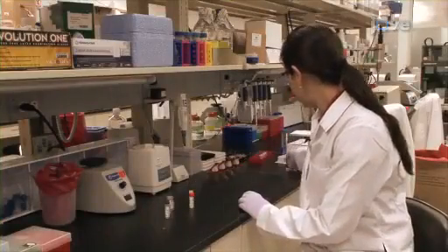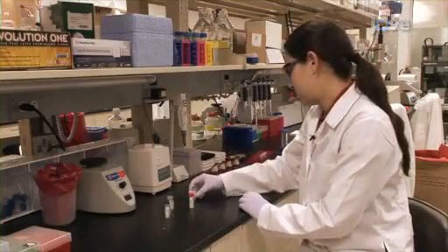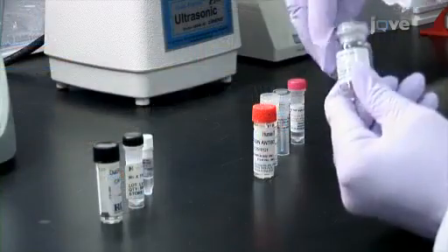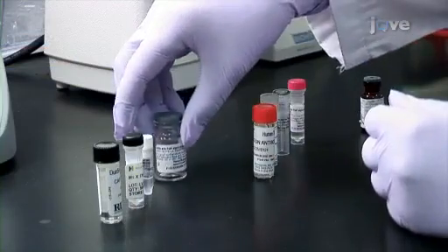Begin this protocol with selection and preparation of four capture antibodies and four detection antibodies specific for human TNF-alpha, as described in the written protocol. Also prepare one confirmation antibody specific for the host species of the capture antibodies.